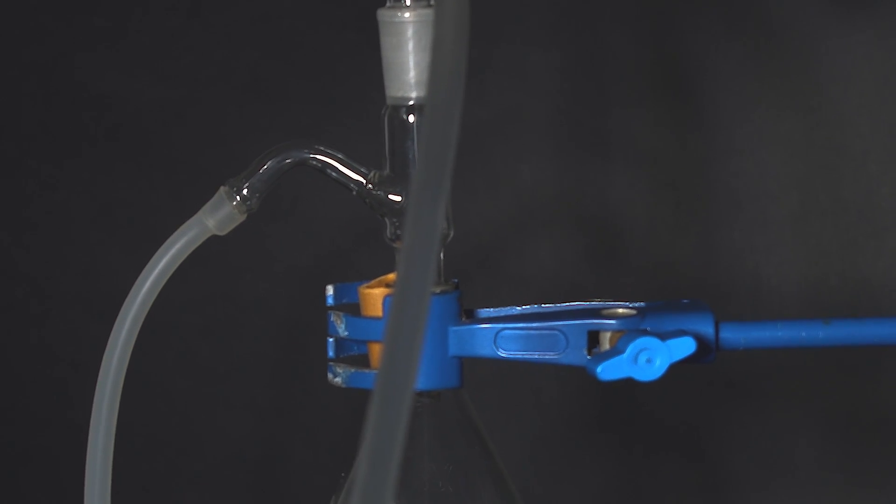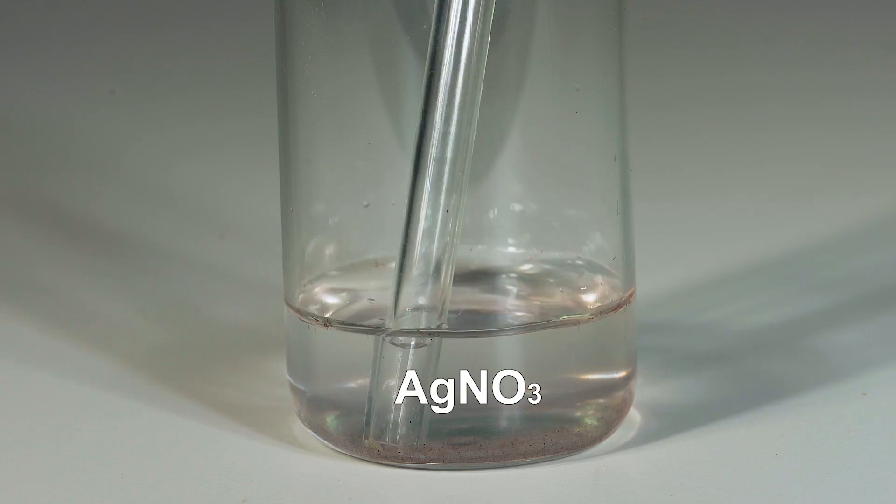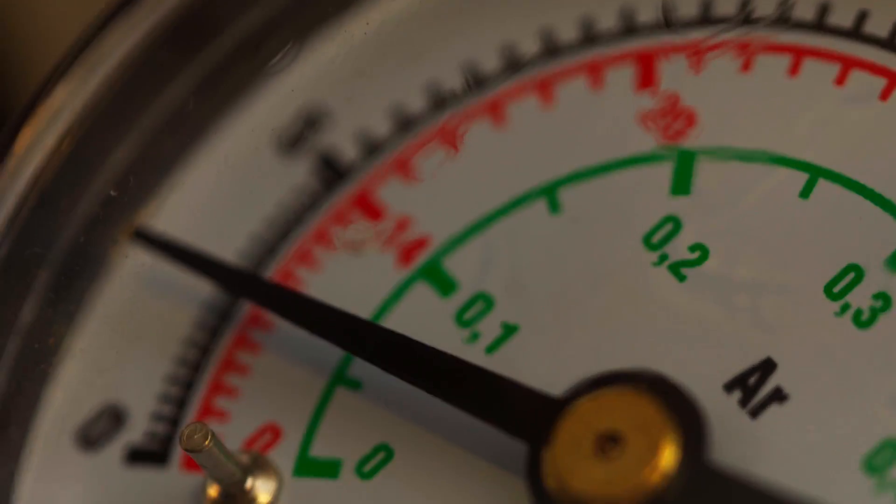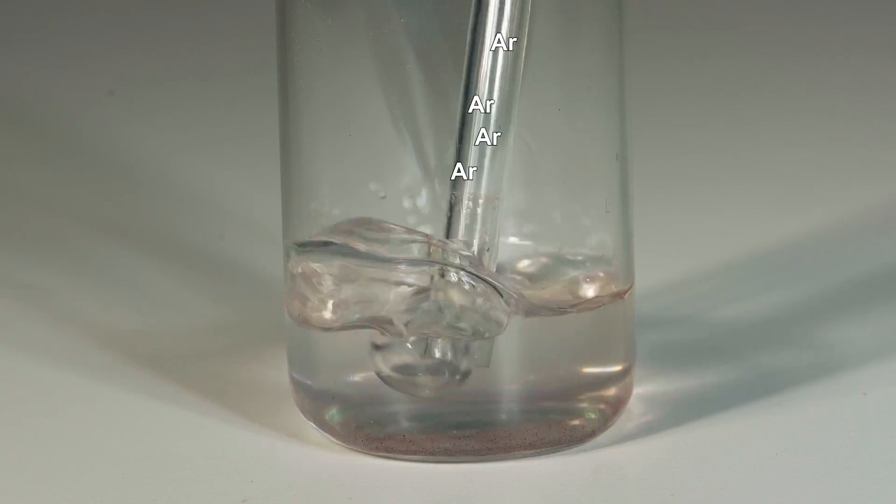I will dip the tube with emitting germane into a silver nitrate solution. I will then feed a moderate argon flow, and then we can start to add germanium tetrachloride to the solution of lithium-aluminum hydride in dry ethyl ether.